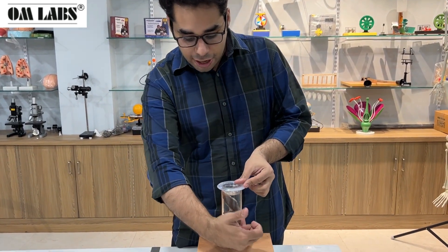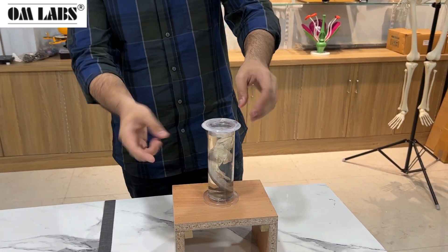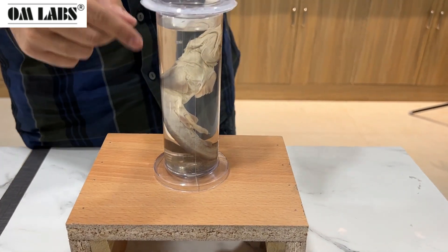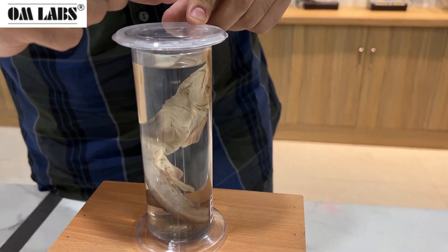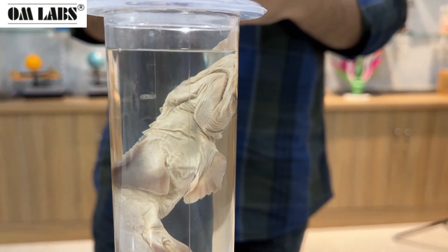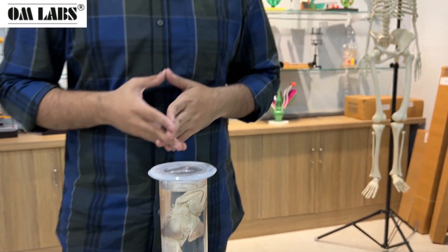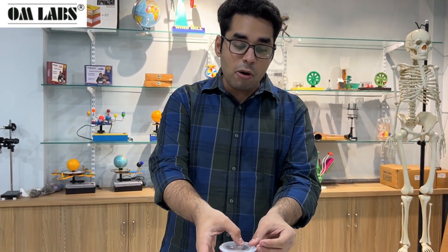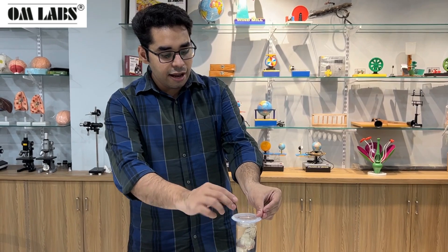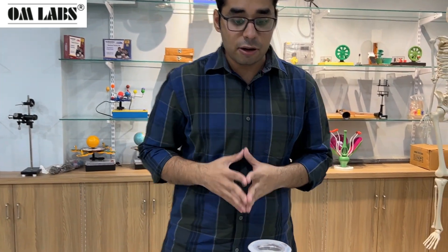This fish is divided into a dorsal side and a ventral side. If I talk about the ventral side, the lighter parts you are seeing — that is the ventral side. On the ventral side, there are some small dots called nares, which are nostrils. These nostrils do not work in respiration but they act as olfactory indicators. After this, the mouth is ventral-laterally located — it is positioned on the lateral side and on the ventral position, so the mouth is present ventral-laterally.